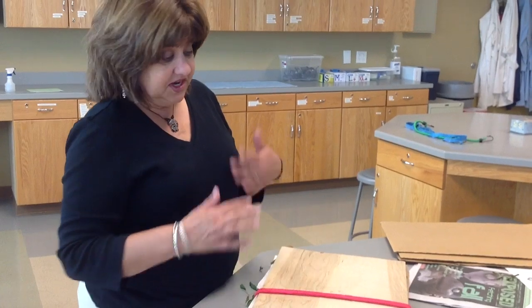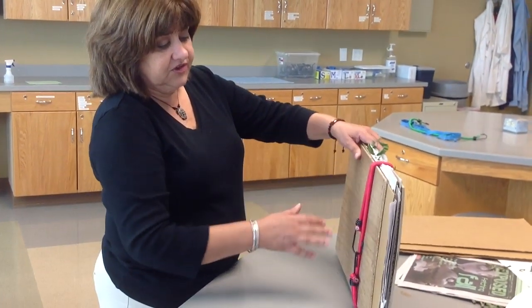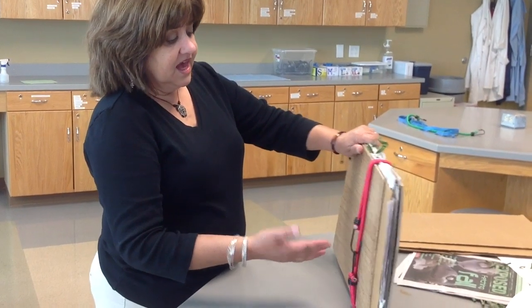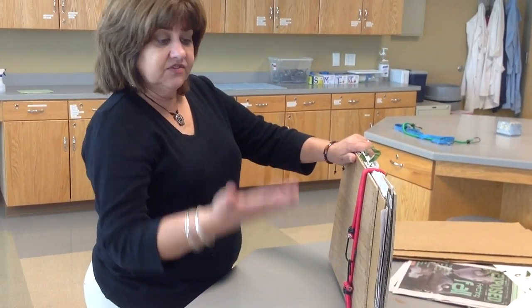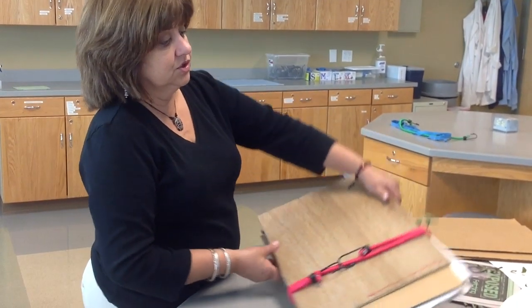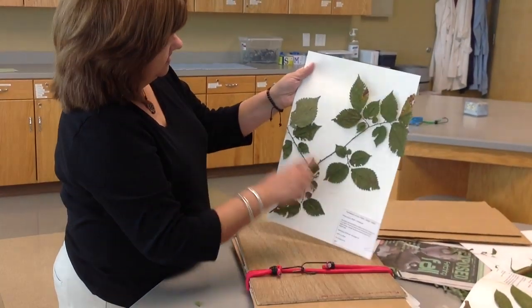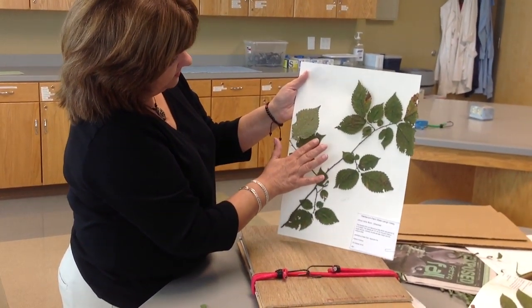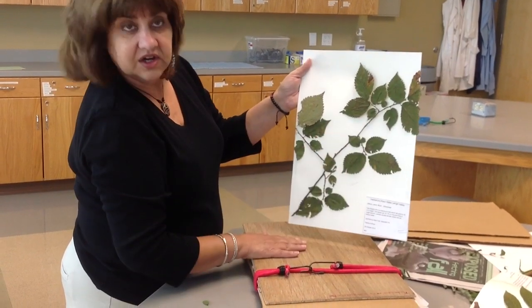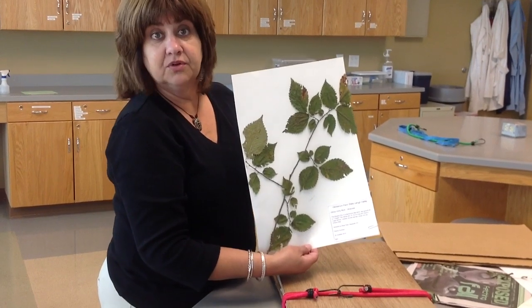The best thing to do is come back in just a day or two, remove any extra samples, open the press, and place the leaves after they've wilted. Because once they dry, they become brittle and are very difficult to move again. You can see on this finished sample they did an excellent job — you can see the underside and the top of the leaf, all pressed very nicely. We will talk about gluing them once we have dry samples.